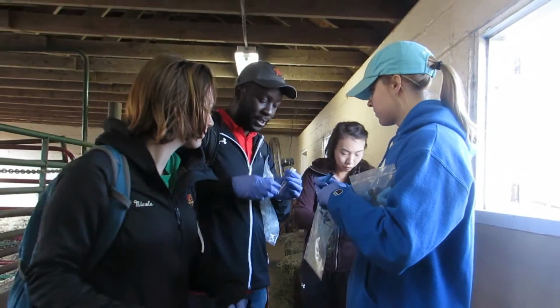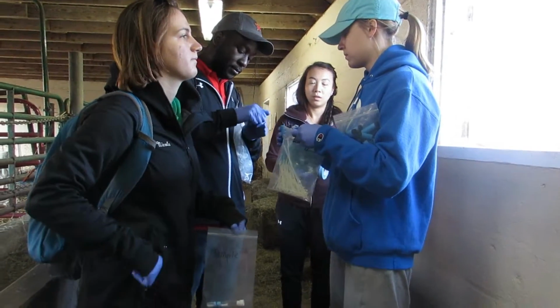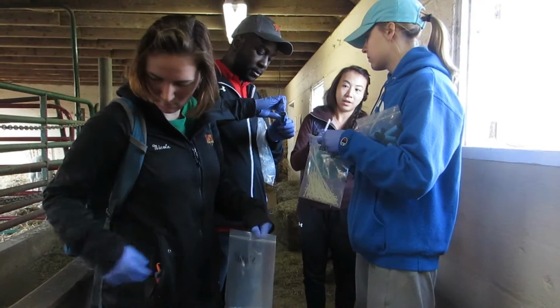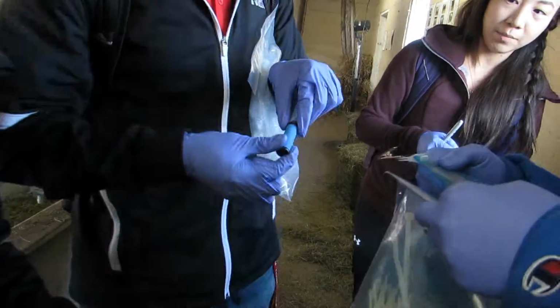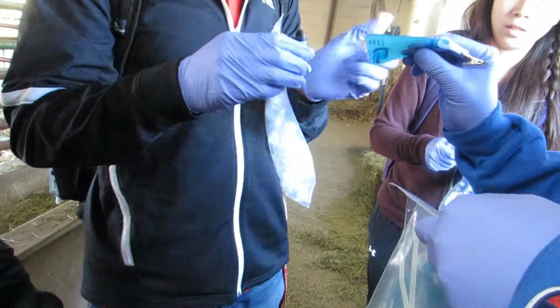Each device required the following: wearing gloves throughout, we opened the radiello tube, then placed the blue diffusive body on top of the tube and held them together. Turning the tube and diffusive body upside down, the cartridge emptied into the diffusive body. Then a triangular supporting plate was twisted onto the diffusive body and the time of sample placement was recorded.